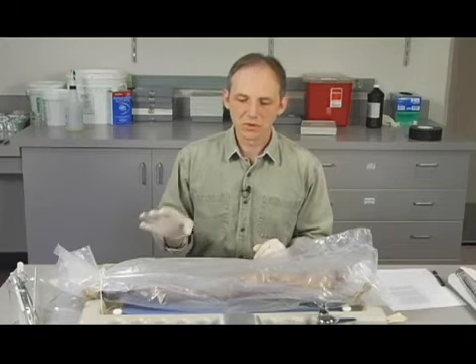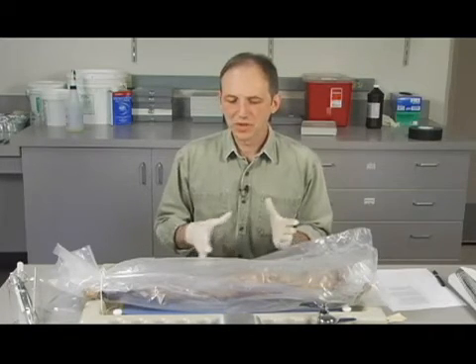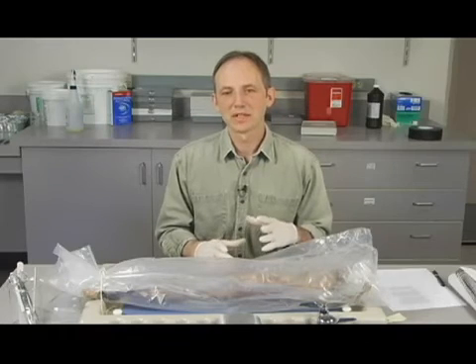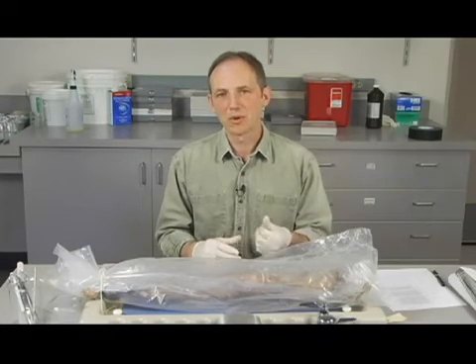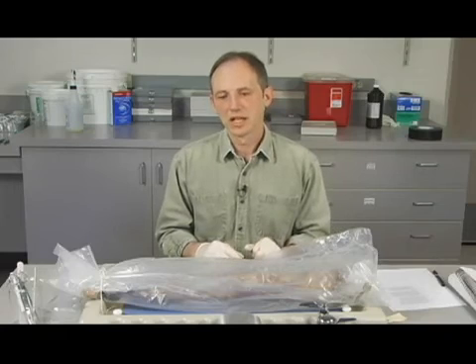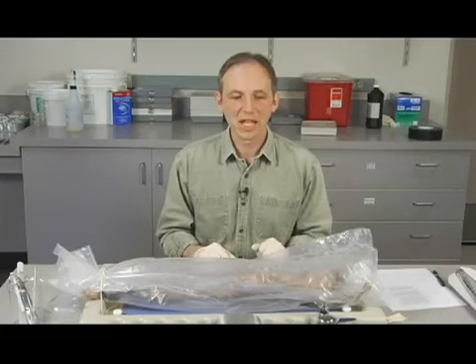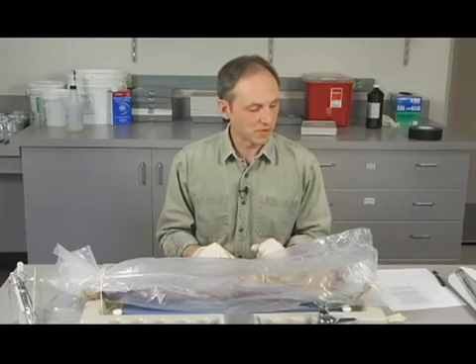Also make sure that your tools are put away, and any tissues that you've removed from the cat, you definitely want to take care of those. As I said before, you wrap that up in paper towel, and that goes into a garbage can. If you've done that, then the table looks clean like it was when you came in, and the next class is going to be happy to see that, and that would be very, very good.